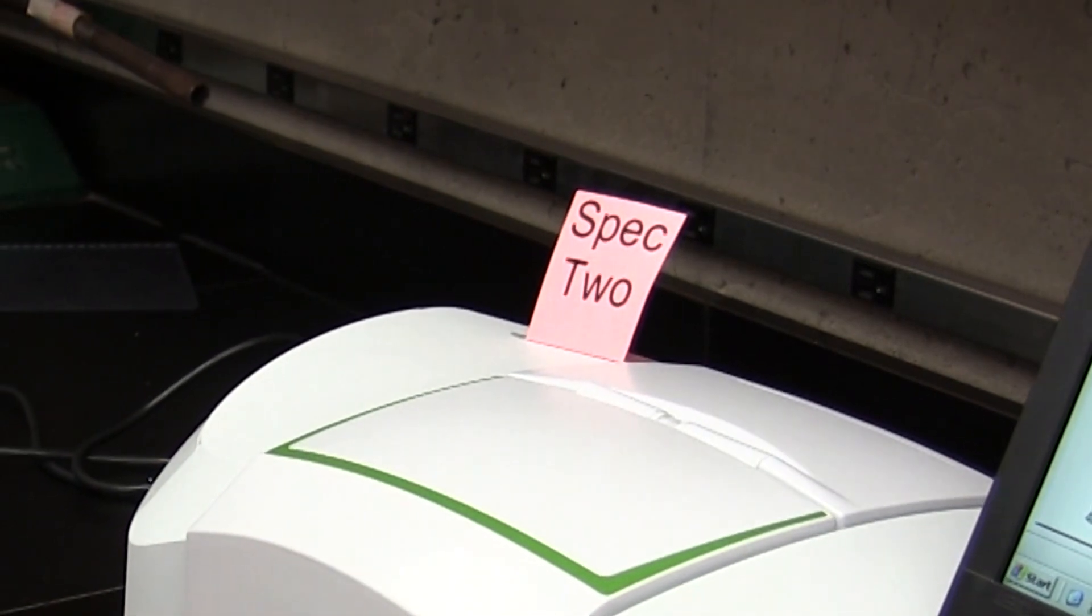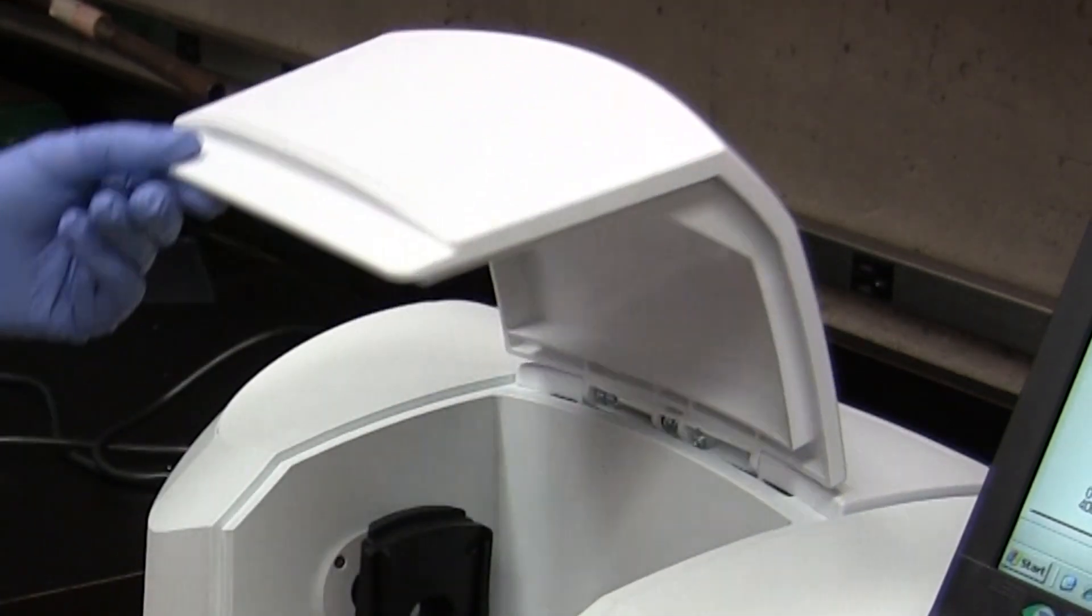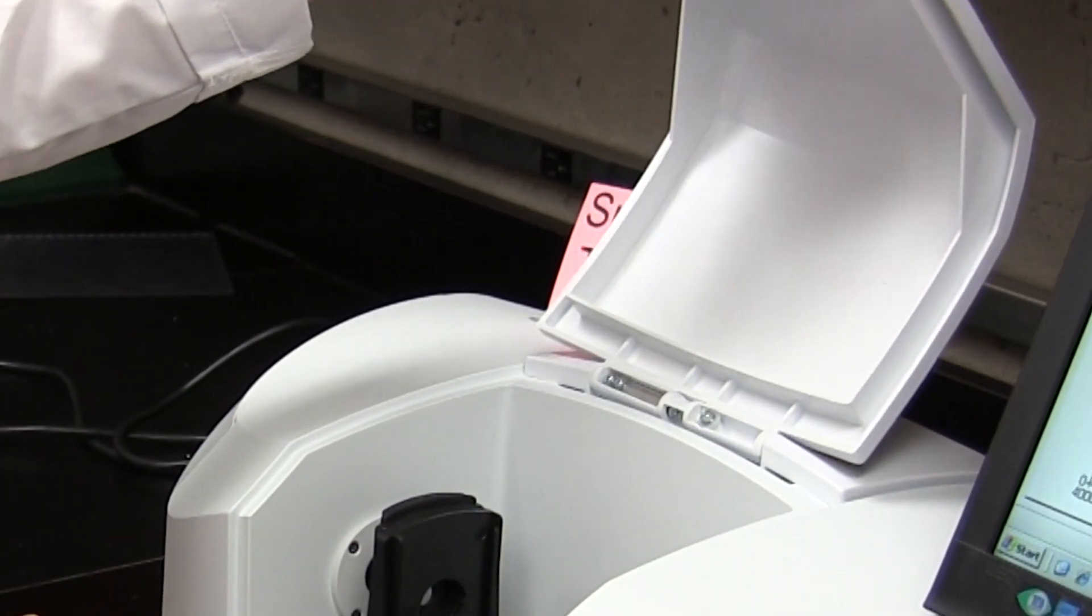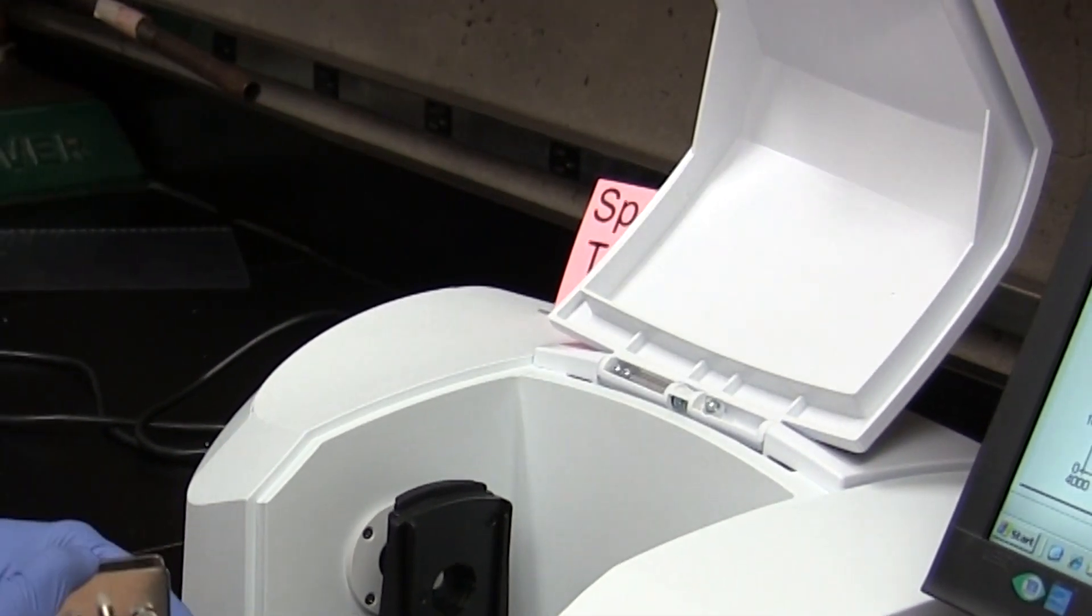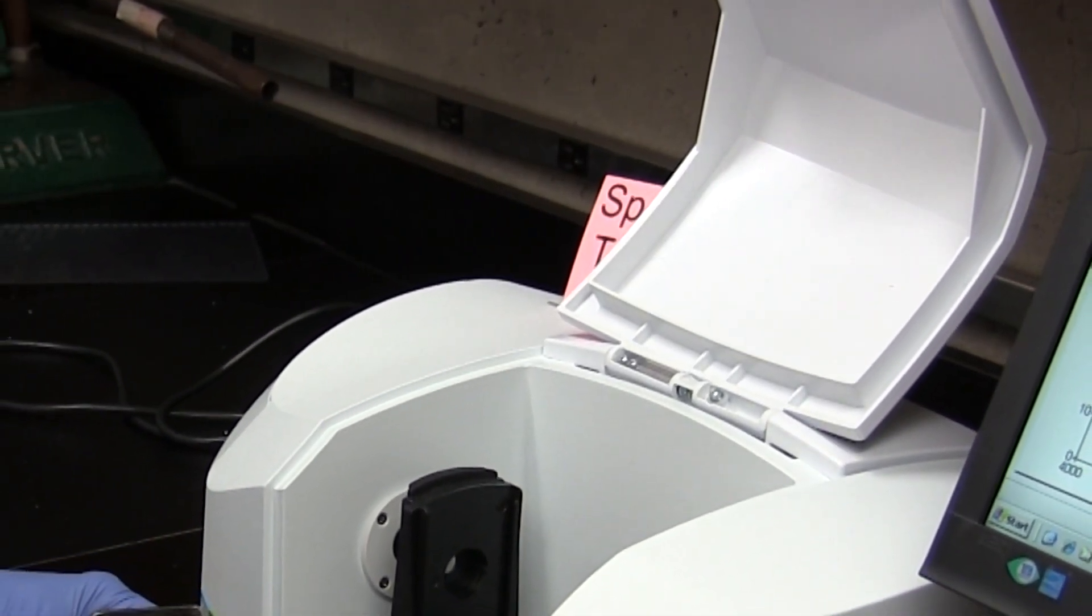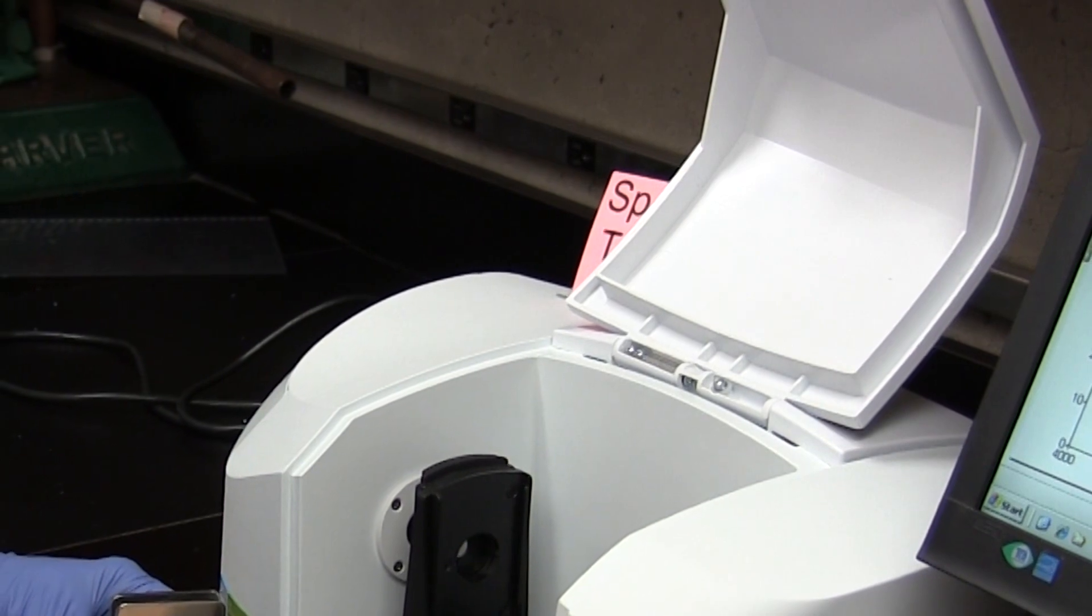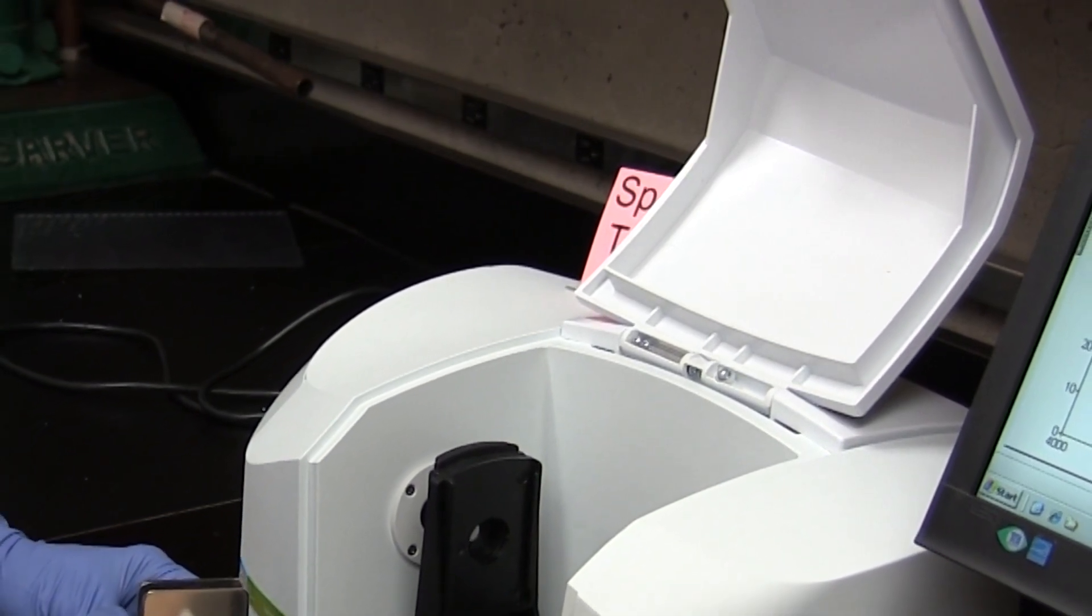SPEC 2 is equipped to obtain spectra via what we call IR transmission. Again, you can read about this in your lab manual. As far as the labs are concerned, you'll use SPEC 2 to obtain IR spectra of liquids only.